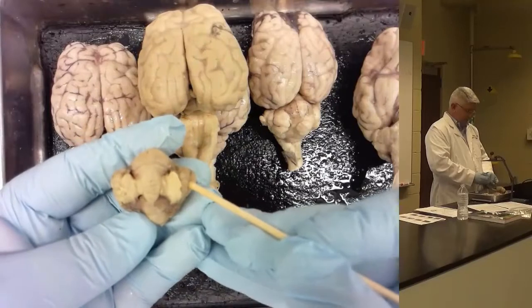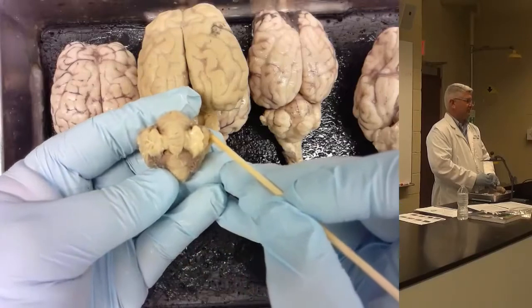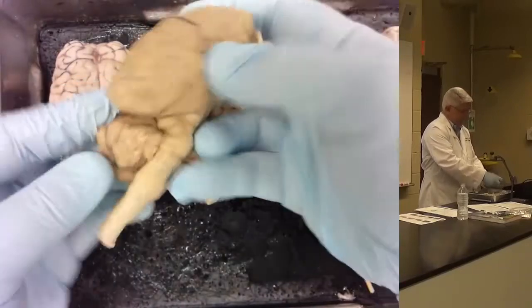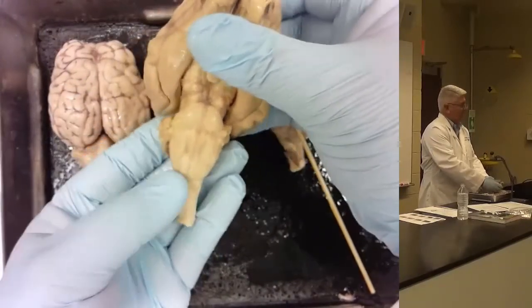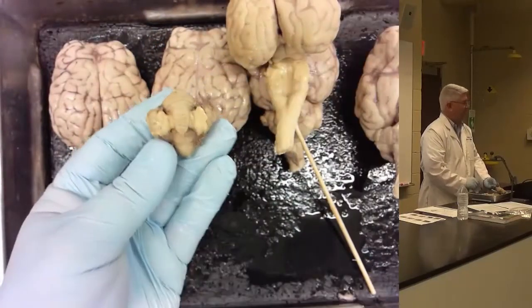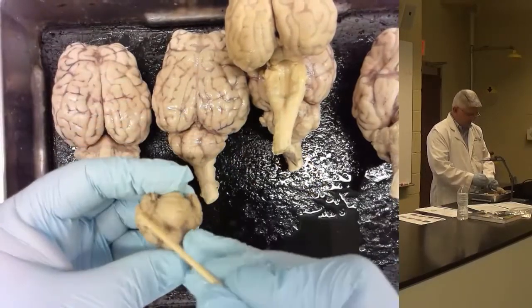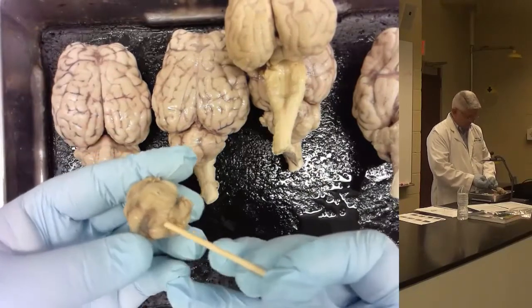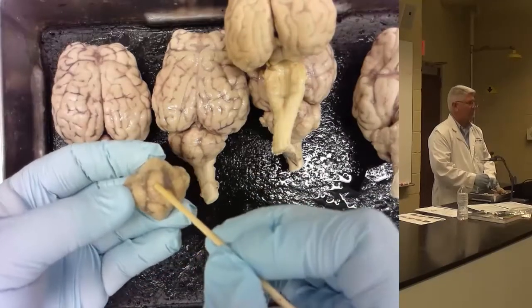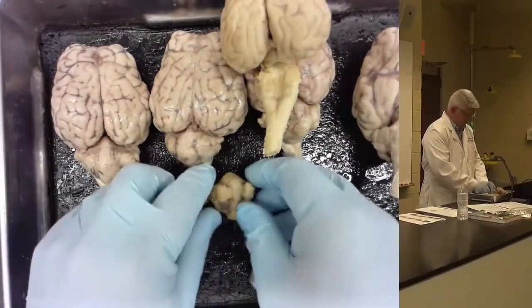And then what's this thing over here hanging off the side of the middle peduncles? The flocculus! Because remember, if this was attached, we'd be looking at the bottom of the brain there. So when we detach it, that's the flocculus hanging over each side. Okay? If we flip this over, fissure prima, anterior, posterior lobe, all of this is vermis. Okay?